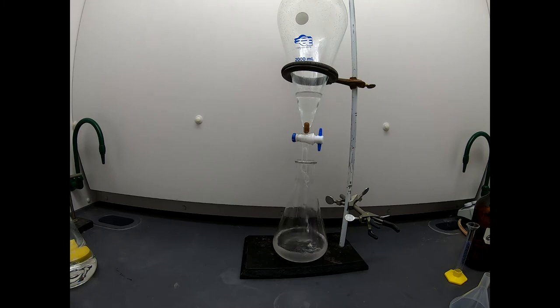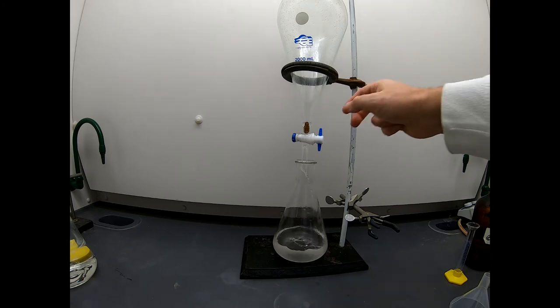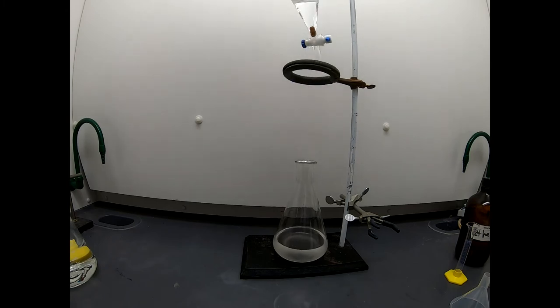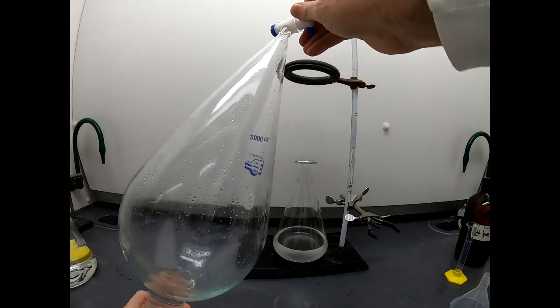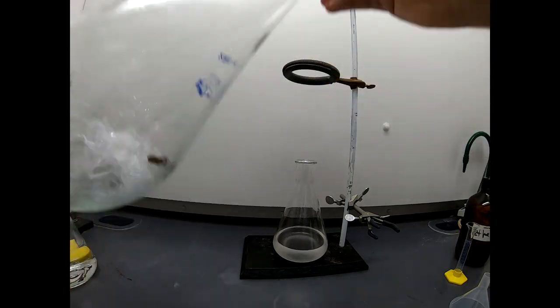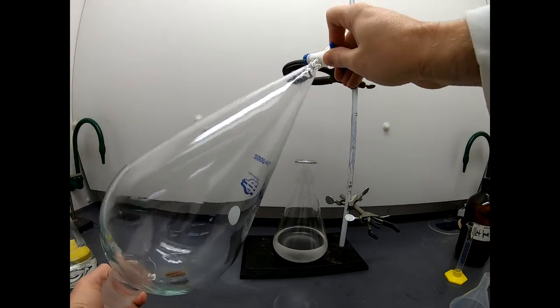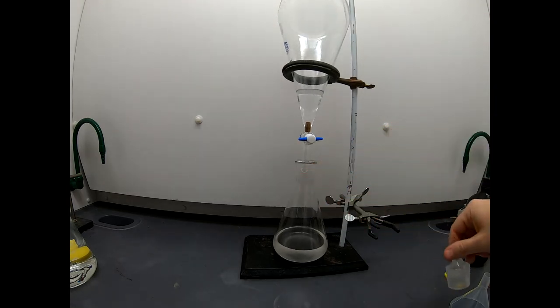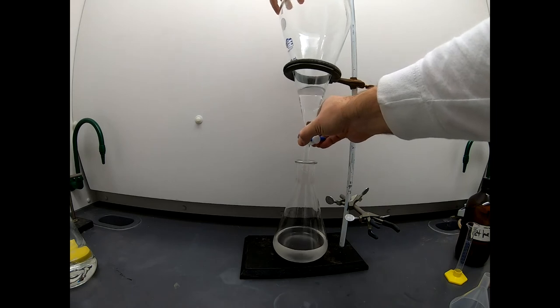And in fact, we're not going to be satisfied with just draining this out. We don't want to leave any residue of product in there. So we're going to have to have a way to collect that product. And again, Mr. Stir bar is making his presence felt. Just slowing things down a little bit. But that's okay. Okay, almost done. I always say I'm not going to let the stir bar go into the sep funnel, but you know, I almost always do. Okay, so we'll just give this a little bit of rinse by splashing around a little bit of ether in here. And that will complete our transfer. Open it up to let that vent, and just swirl that around a little bit. That's good enough.